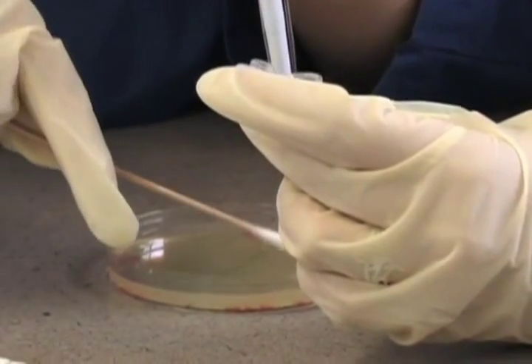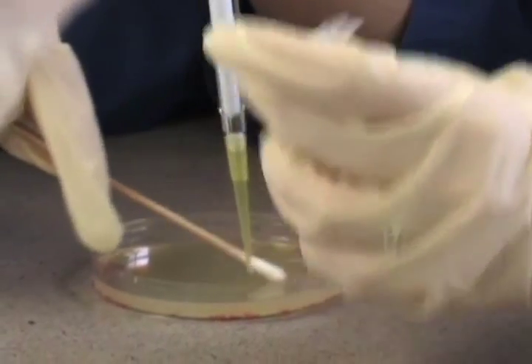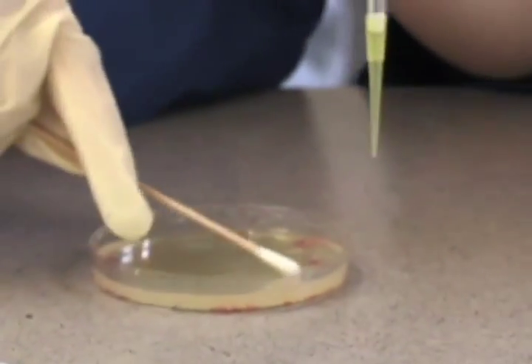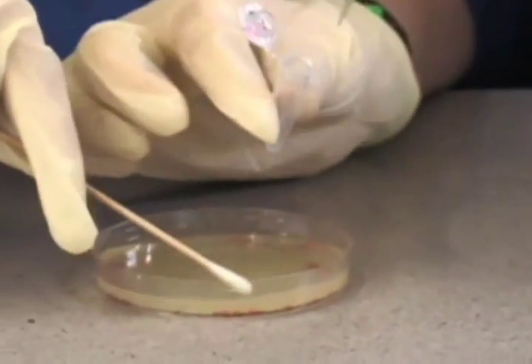Yesterday, we used site-directed mutagenesis to mutate specific sites on a GFP plasmid. And today, we will transform the mutated and unmutated control plasmids into bacteria.